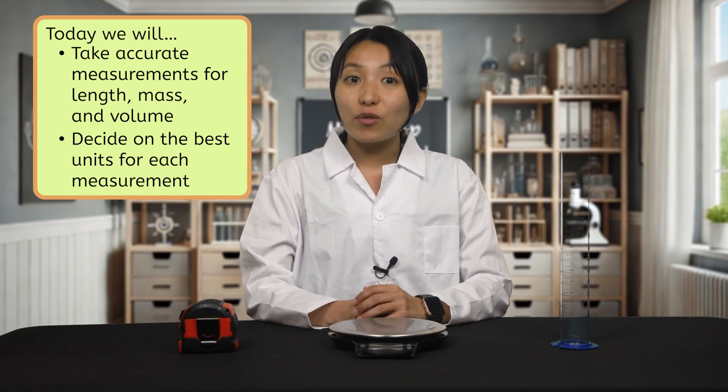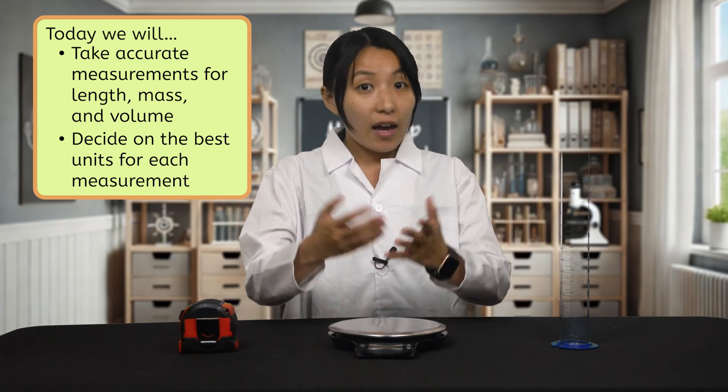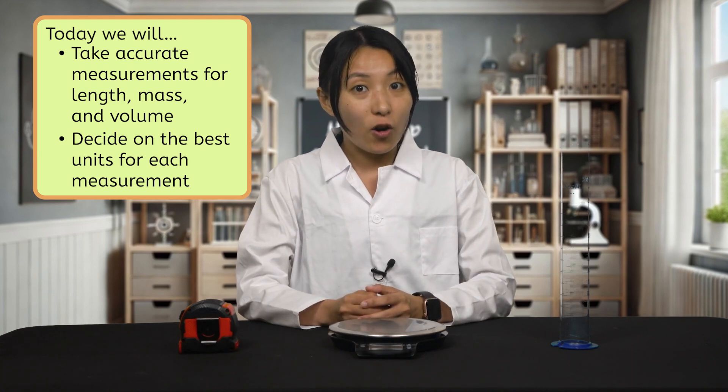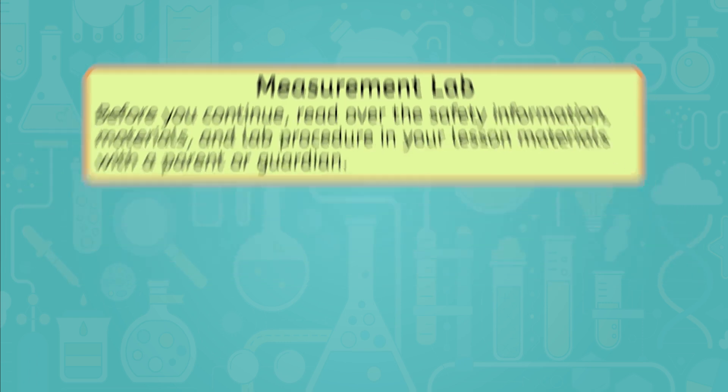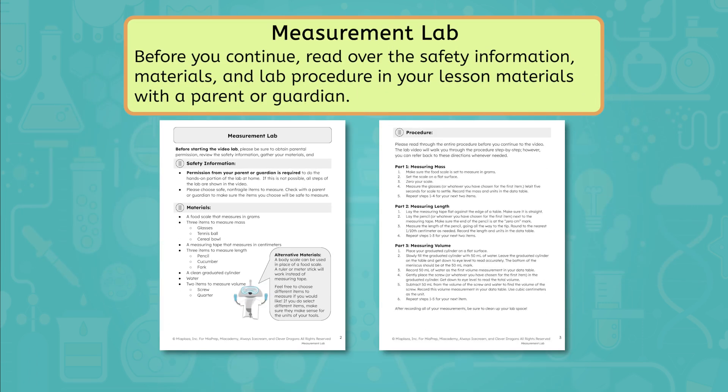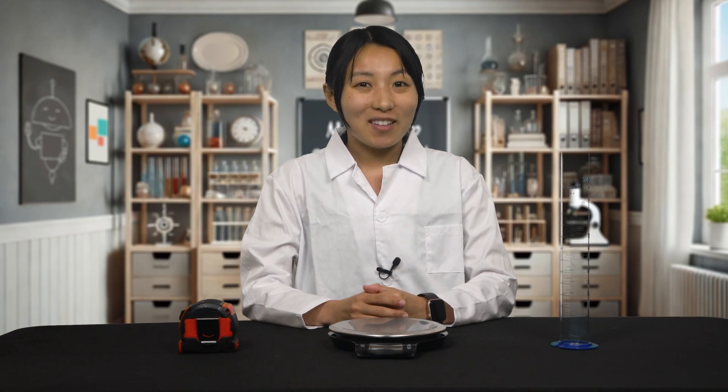In this video, I'll walk you through some of the activities in this lab and you'll have a chance to try them on your own at home as we go. Before you continue with this video and lab activity, pause here to read over the safety information, materials, and lab procedure in your interactive lab notes with a parent or guardian. Once you have your parent or guardian's permission, you can use your own materials at home to follow along with me.